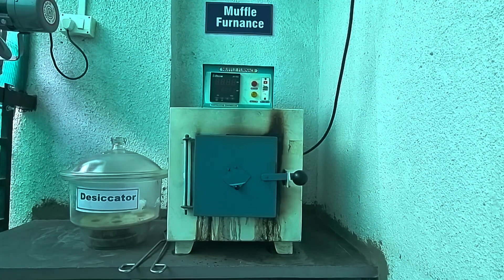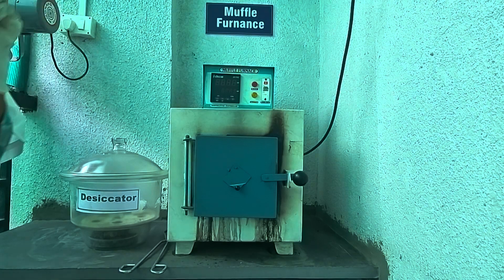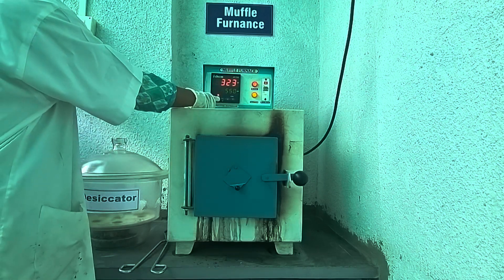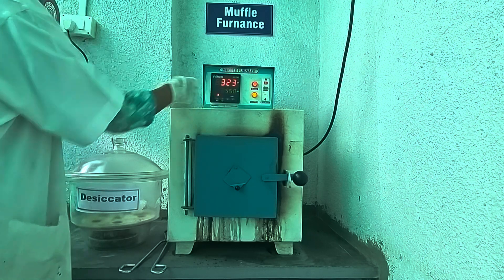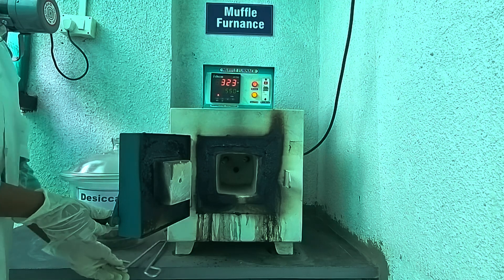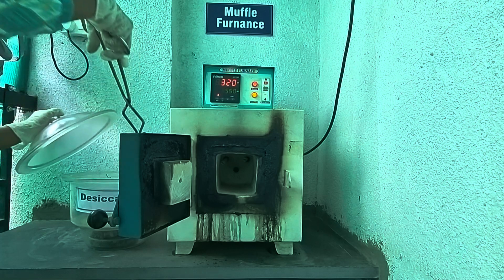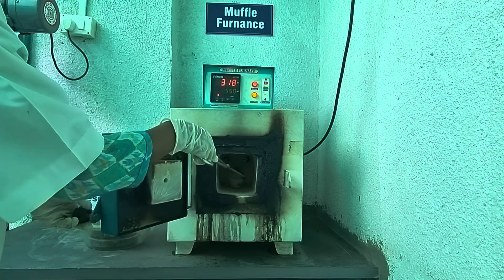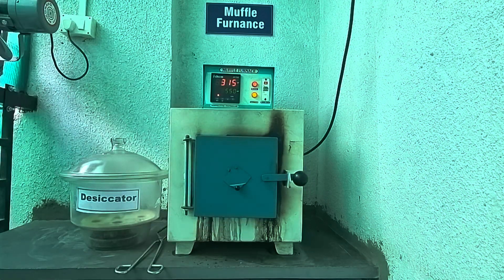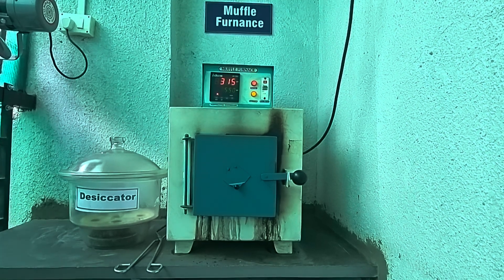After taking the weight of the sample, we will keep this silica crucible along with the sample in a muffle furnace. For this, we have to switch on the instrument. We have already set the temperature to 550 degrees Celsius. We have to carry out the ash content at 550 degrees Celsius. Open the door of the furnace and we will keep the silica crucible in the furnace for ashing purpose. It will require around 3 to 4 hours — within 3 hours the ash content procedure will be complete.